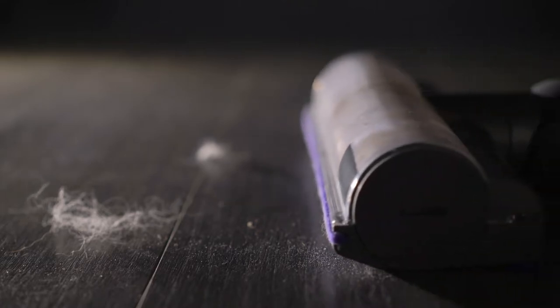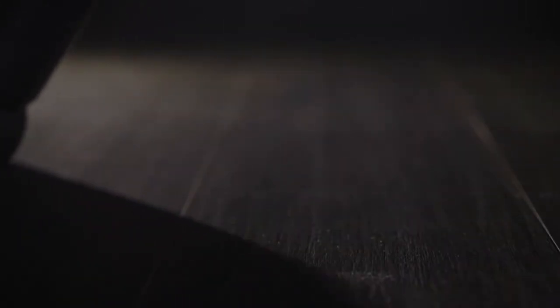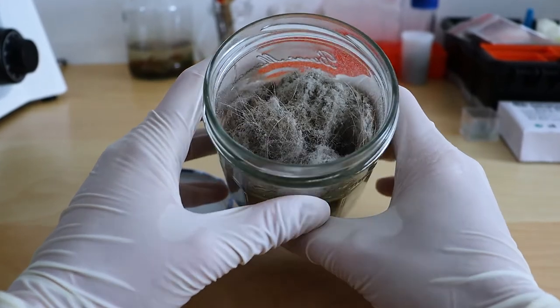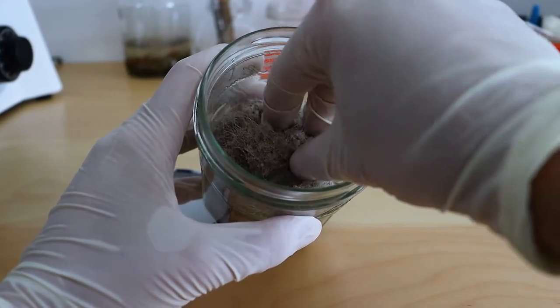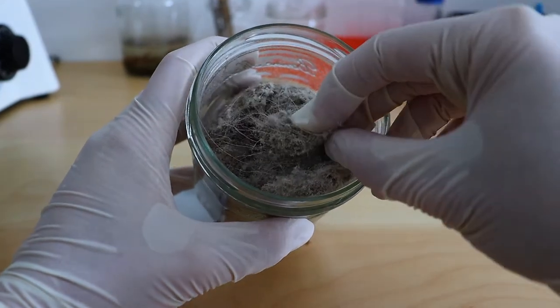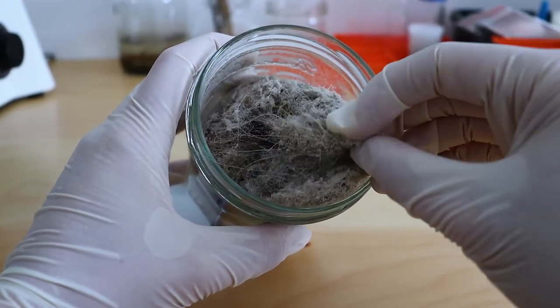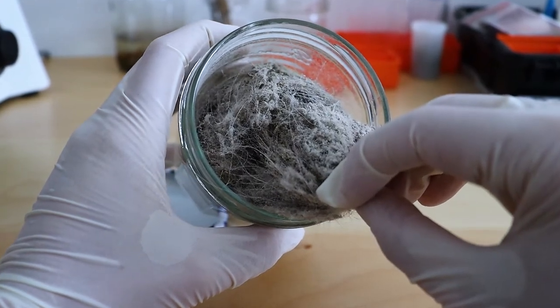To collect the samples, I used a vacuum cleaner to clear the floors of my apartment, some upholstered furniture, and the dog's basket. After that, I emptied the container together with the filter, and the result looks like this. Now I'm curious to see what we might discover under the microscope.